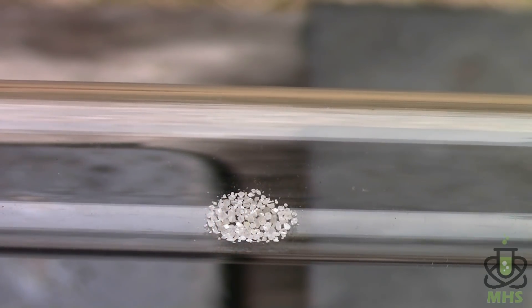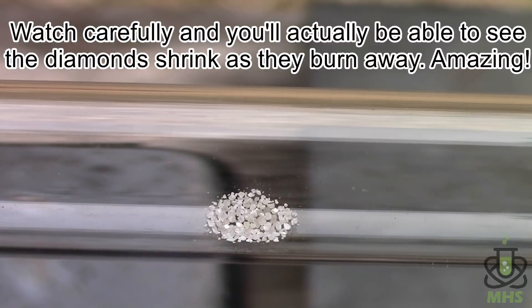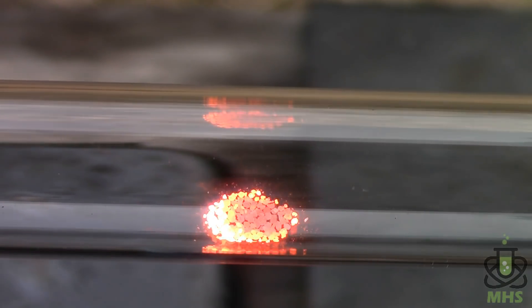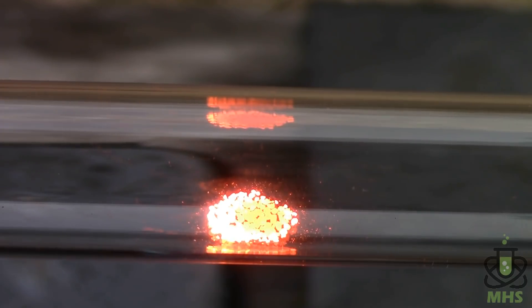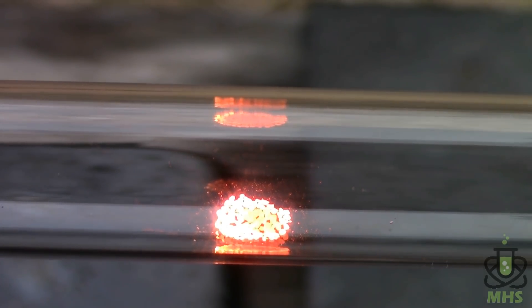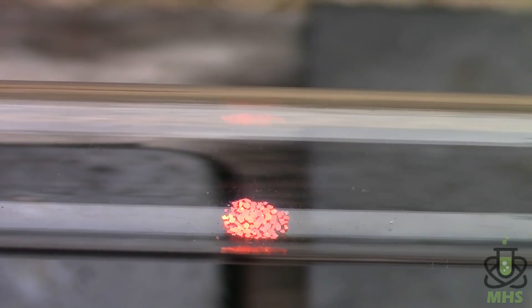So let's heat these back up. Again, when I remove the heat, they continue to burn, and if I increase the oxygen flow, it gets a little bit brighter. And then as soon as I turn the oxygen off, they die down right away.